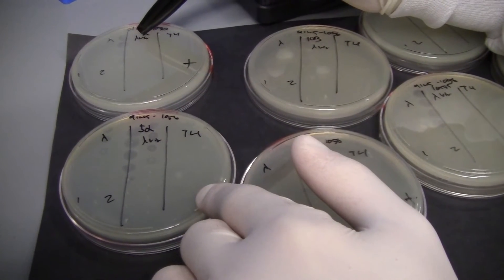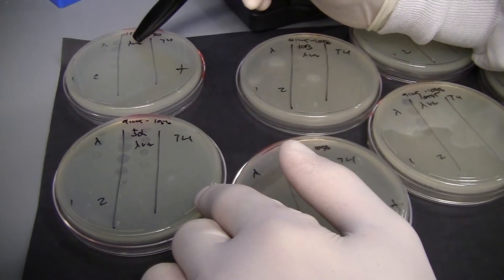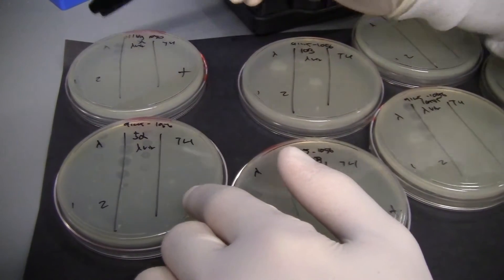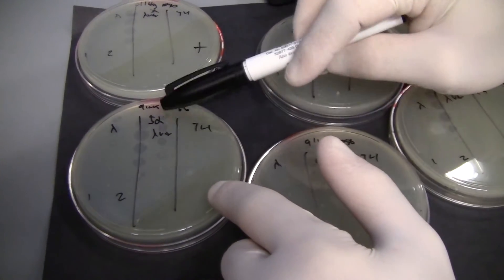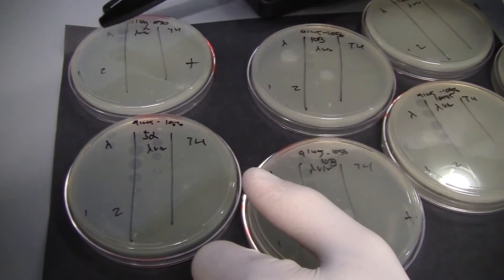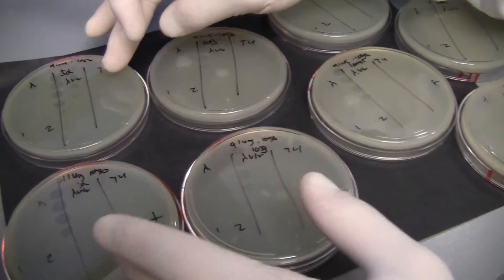Lambda vir is a mutant of regular lambda that in normal E. coli strains will always go into lysis — it won't do lysogeny. It's a vir strain because it had C1 and the promoter driving C1 knocked out; however, our cells provide C1, which makes for an interesting experiment. On the uninduced plate I see clearly five orders of magnitude of clearing, but as soon as we dimerize C1 using the TraR/AHL combination it's completely protected. So again, two very clear phenotypes right off the bat.